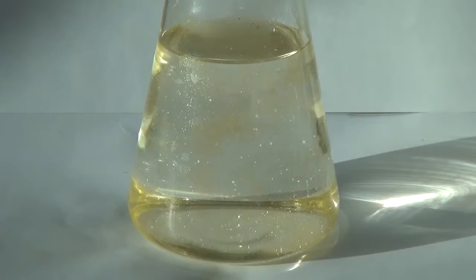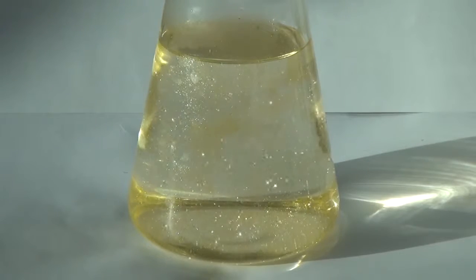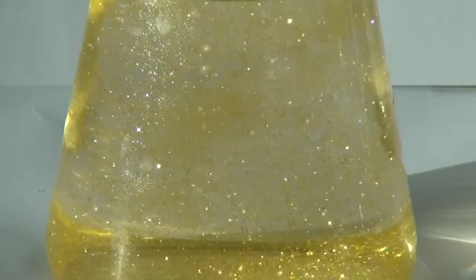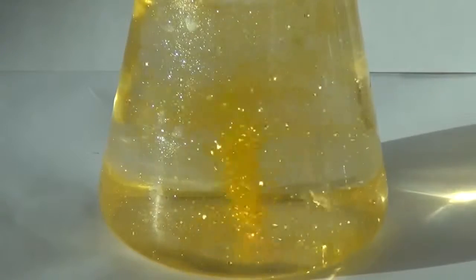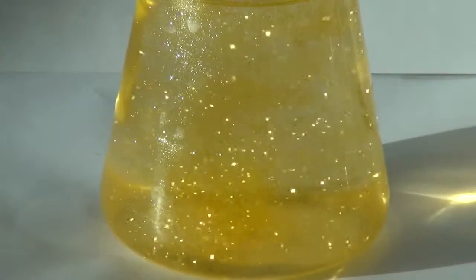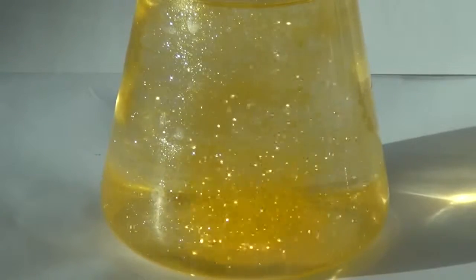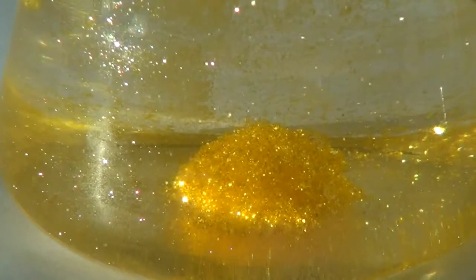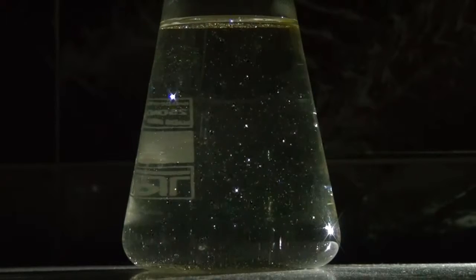This experiment looks better in bright sunlight. The flakes of lead iodide are very strongly reminiscent of golden glitter, hence the name of this experiment: the golden rain. This experiment also looks very nice in the dark under the right light conditions.